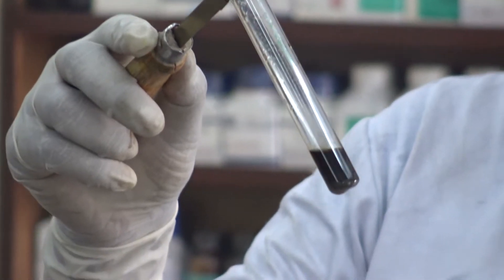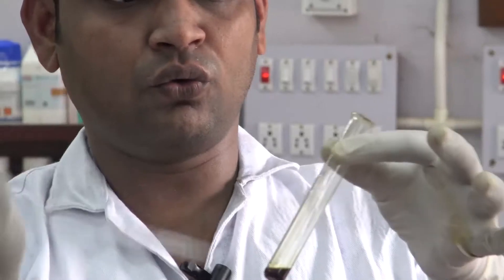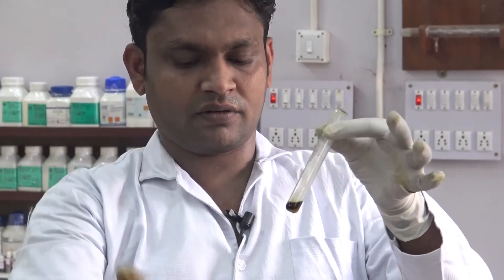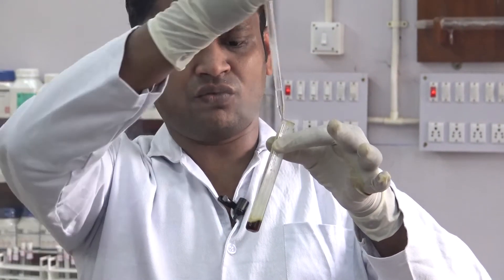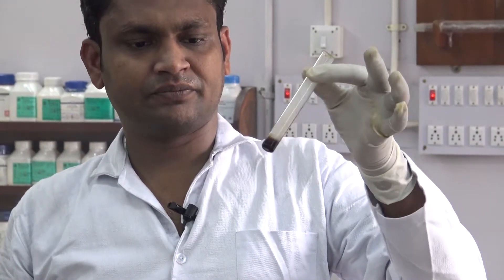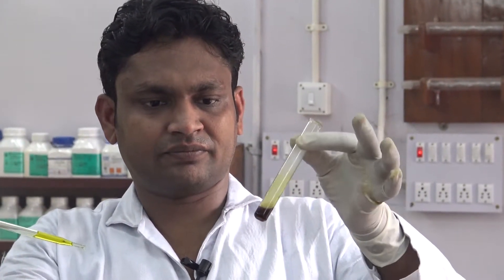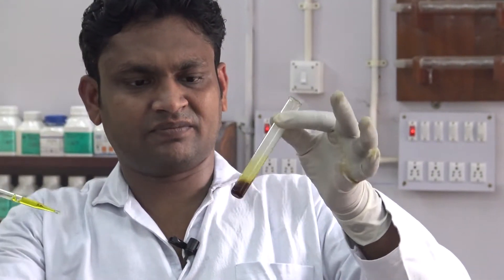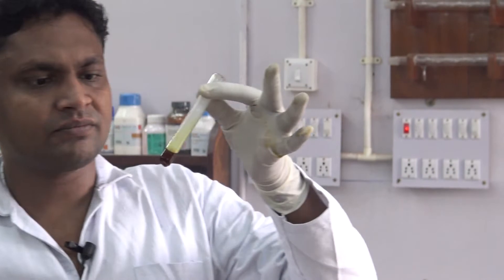This confirms the presence of the aromatic nitro group in our compound. To another part of the filtrate, add 2 drops of benzoyl chloride and shake it. Then add 2 drops of concentrated HCl. To this mixture, add 2 drops of ferric chloride solution. Formation of a red precipitate or red coloration confirms the presence of the nitro group.